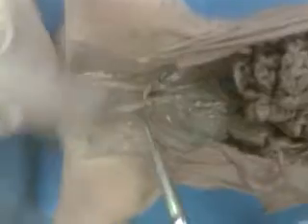There you go. So, there is an umbilical artery, which is a branch of the internal iliac artery, and then that would be probably the common iliac.